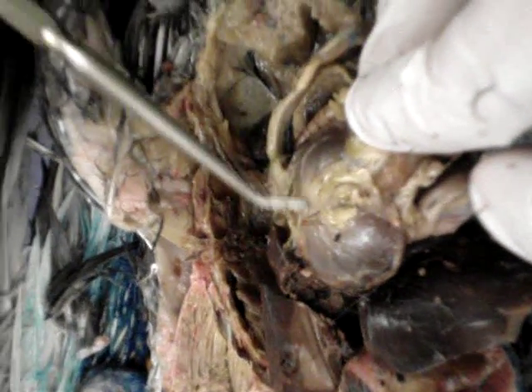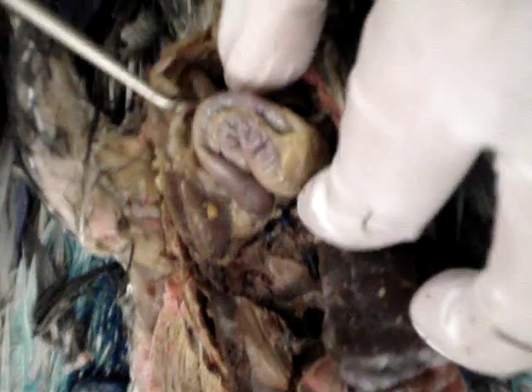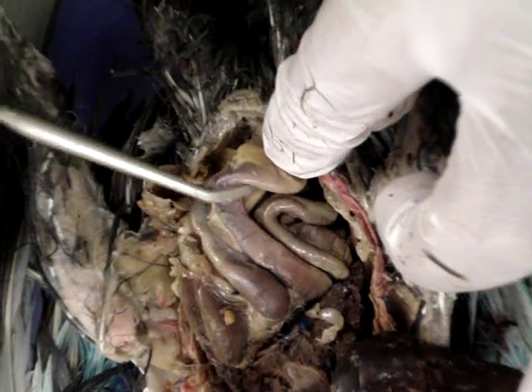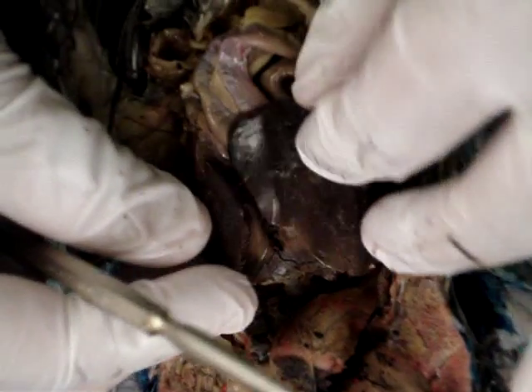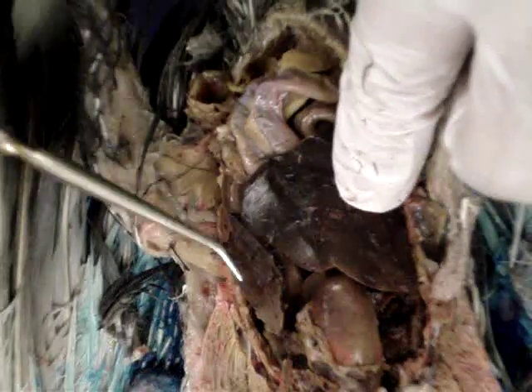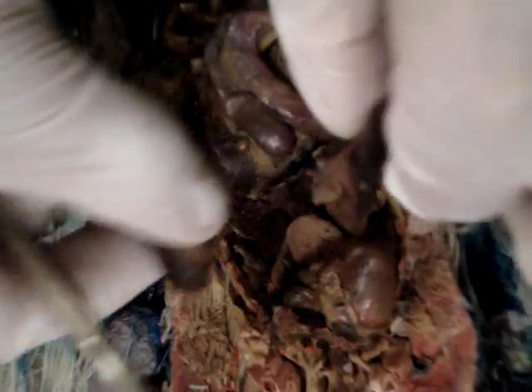Heart structure. The intestines are these here. The liver is this dark section here — on both sides. Removing the liver.